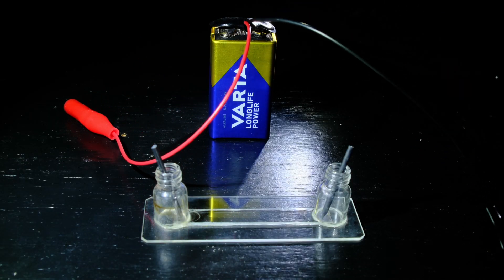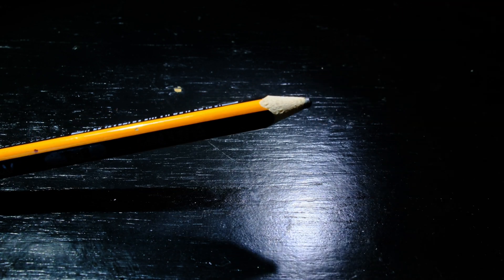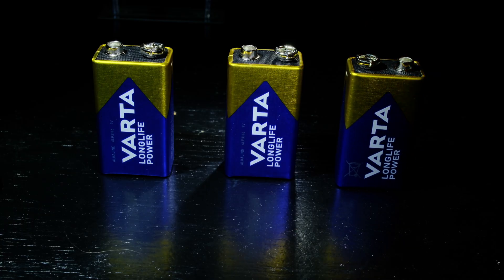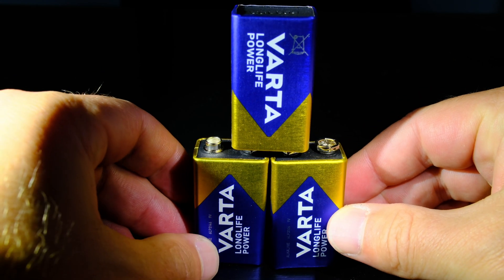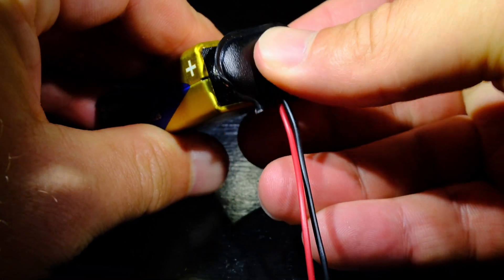For simplicity, I resorted to electrodes made of pencil lead. It is very easy to extract them from a pencil with a knife, and they are highly conductive. As a power source, I resorted to three 9-volt batteries. Using all three in series, we can generate voltages of up to 27 volts. The batteries will be connected to the electrodes with crocodile clamps. The hardware setup is ready.